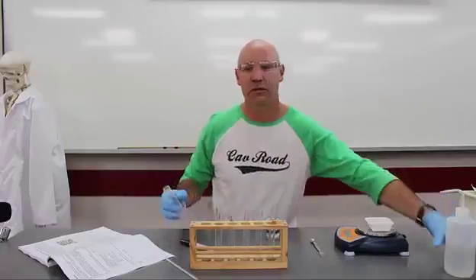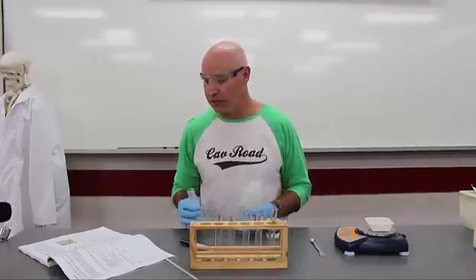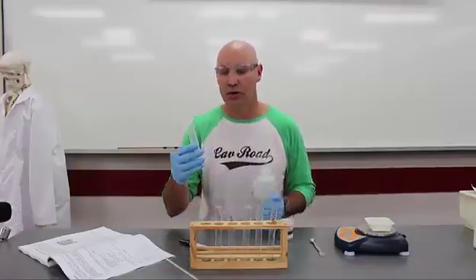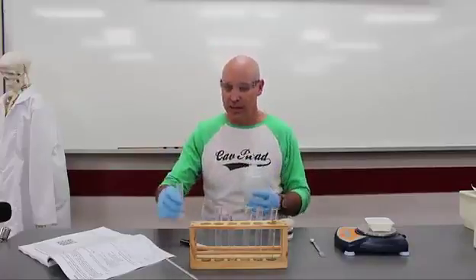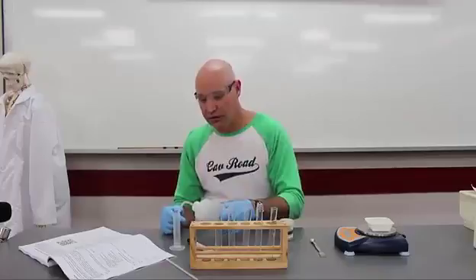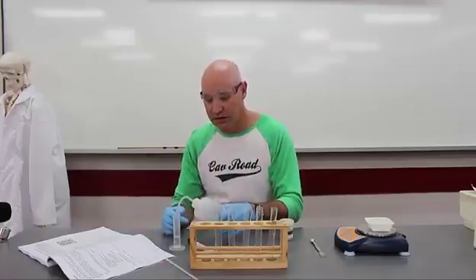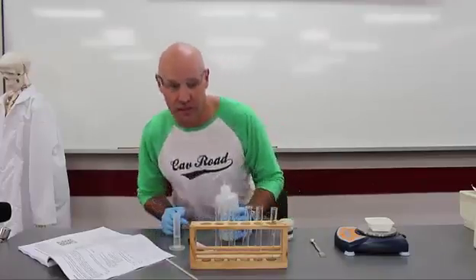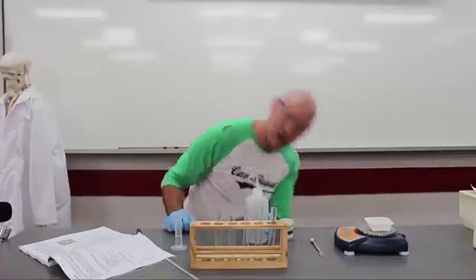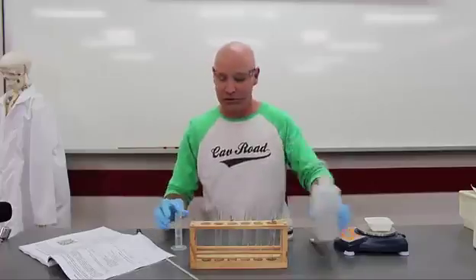And the amount of water is going to be the same for each. So the first step, after you've labelled your test tubes, is you're going to add 10 mils of distilled water to each. Now, we're going to use the distilled water in the distilled water bottles, and you're going to squeeze it into a measuring cylinder. You just need to be very careful about a parallax error, so you need to get down low to make sure it's exactly 10 mils.